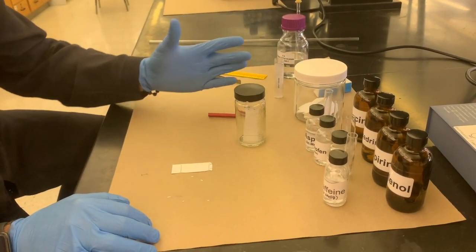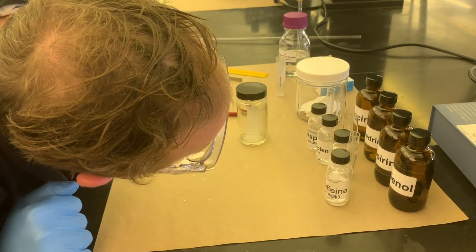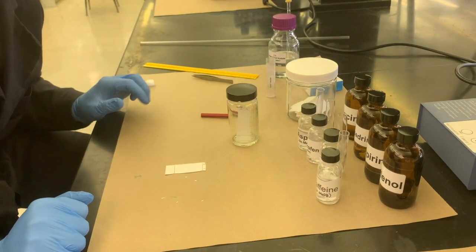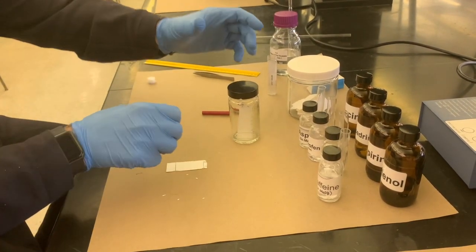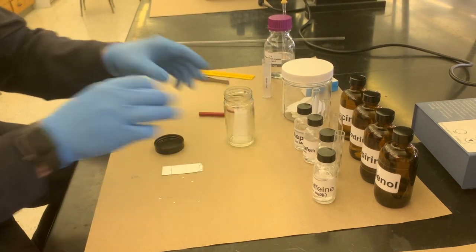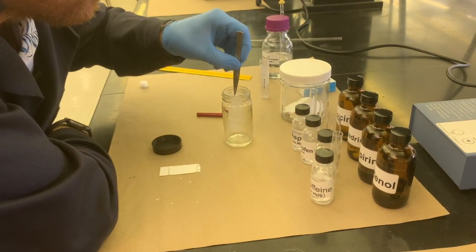All right, so we've been waiting about 5-10 minutes, and the TLC plate has gone all the way up to close to the A and the C, a little bit short of them, but that's fine. It's more of a proportion than it is an actual distance. So we'll open up this TLC chamber very carefully so as not to disturb the eluent, and we will reach in and grab that plate.